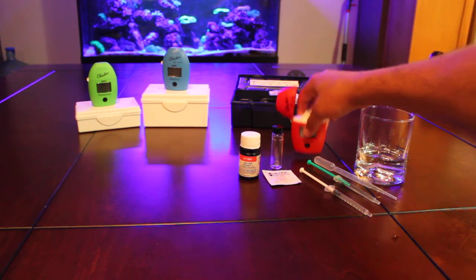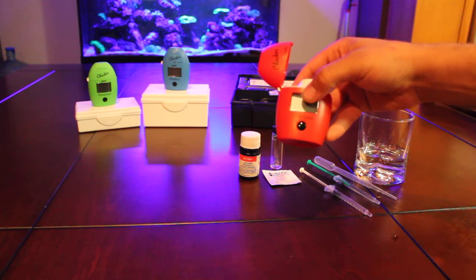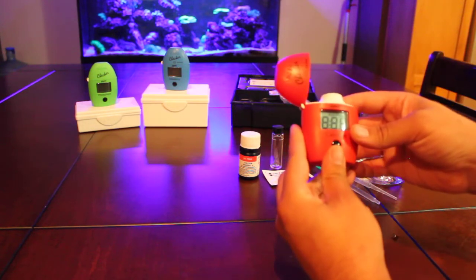Okay, here's the Hanna-Checker calcium test. I'm just going to turn that back in.